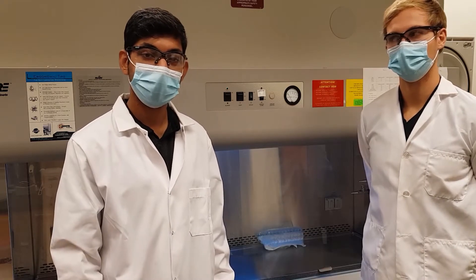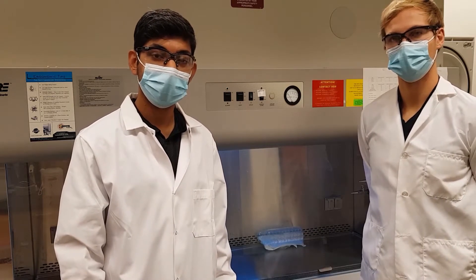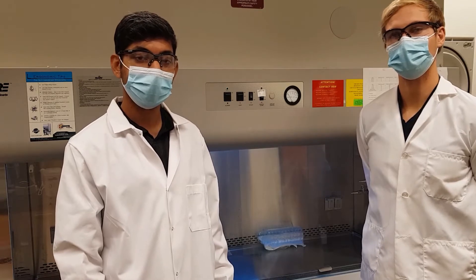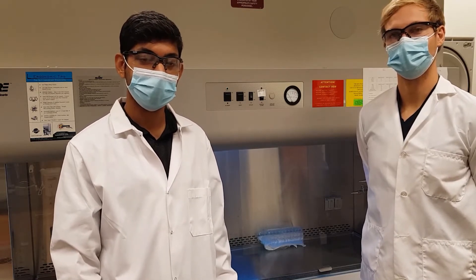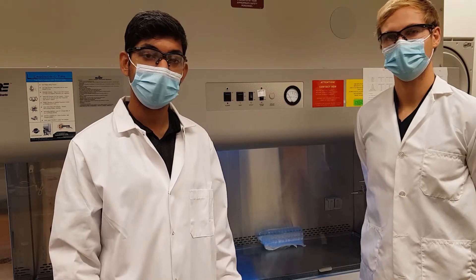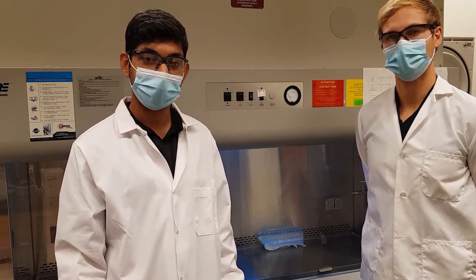Hello, my name is Dushan Vishwanath. I'm Daniel Khaizemar. We are third year PhD students from the group of Professor Yuryan Won in the Davidson School of Chemical Engineering. Our research specializes in the biotechnology research area with a focus on nanomedicine for cancer and respiratory distress. Today we'll be showing you some of the facilities we use in the biotechnology research area.